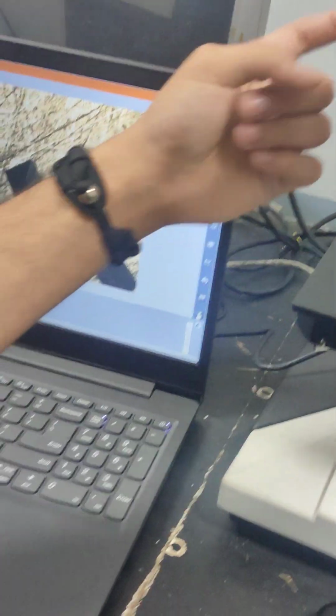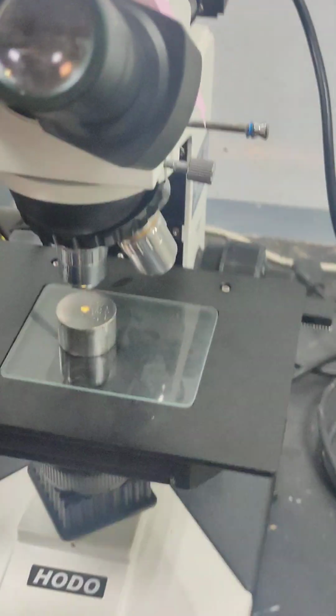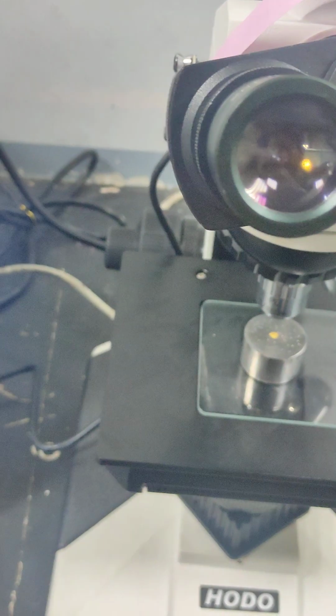So the professor said that you can use this by pushing this, and then it'll turn this off. As you can see now, watch how I do it. I push it in. It'll simultaneously turn off, and then you can see it here. Probably wouldn't see it on the camera, but I think we can see the light on the camera lenses.